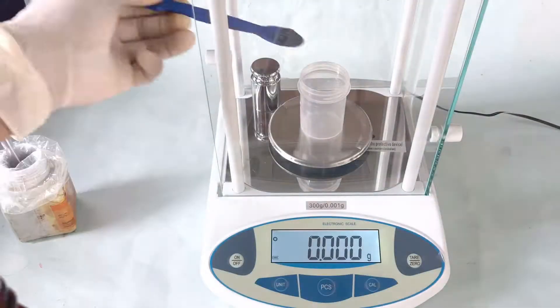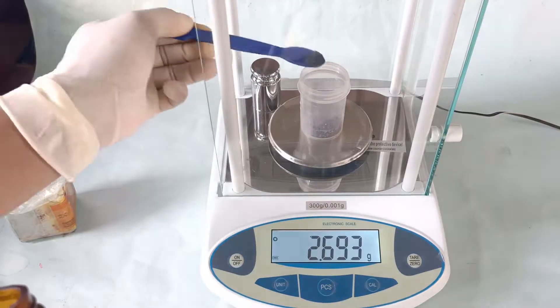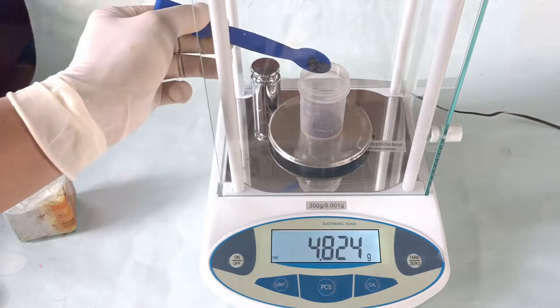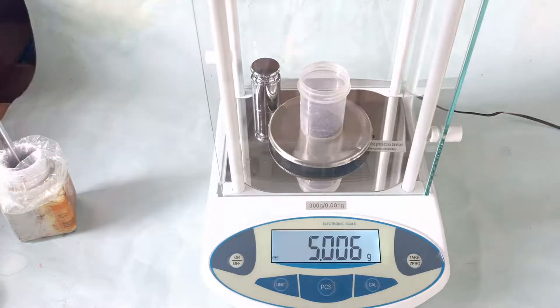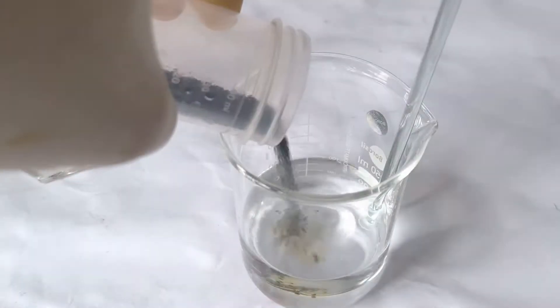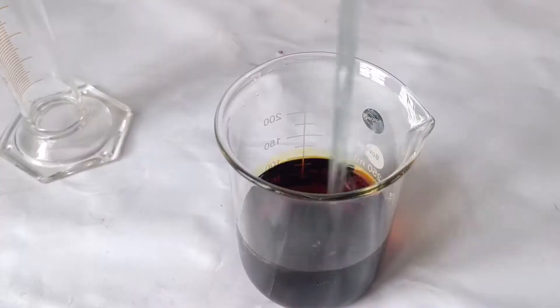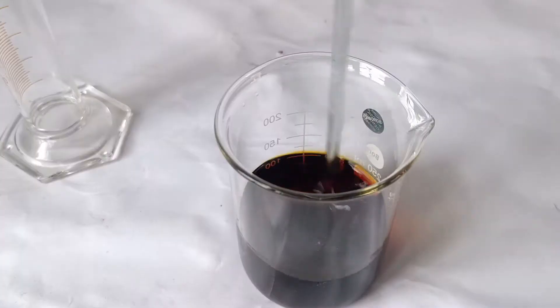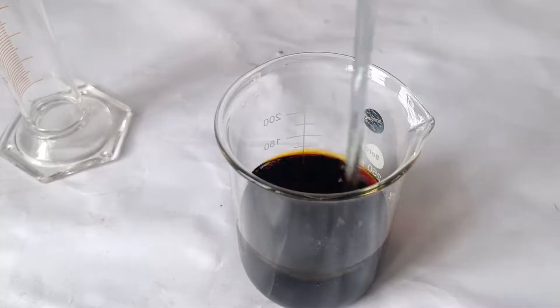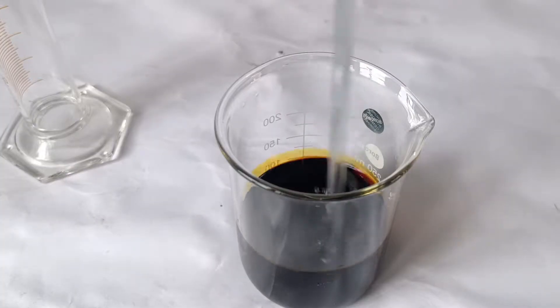Now weigh 5 grams of elemental iodine crystals and add it to the iodide solution. Stir to completely dissolve the iodine crystals. You may warm the beaker on a hot plate to speed up the dissolution of the iodine.